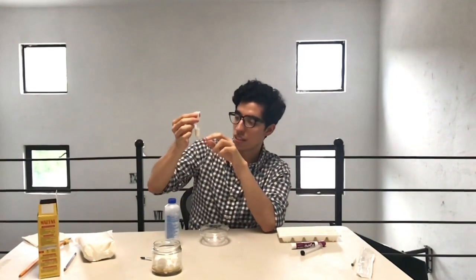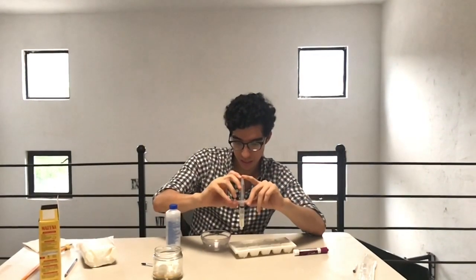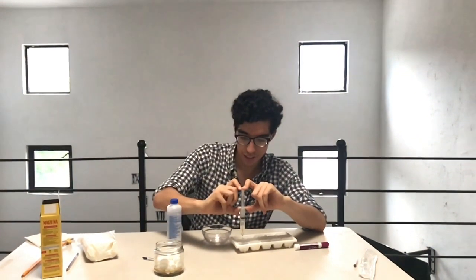This is the ethanol and this is the corn. So just with the plug, carefully drop the first drops in your ice cube palette like this. I will try to show, but we need to put in a little effort. And there are our first drops.